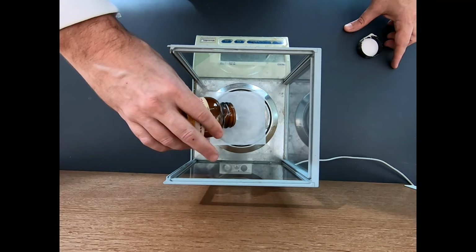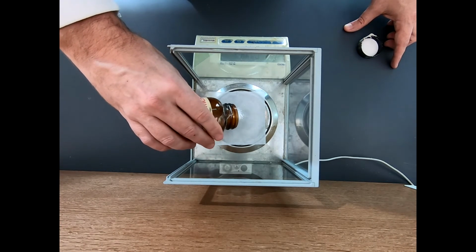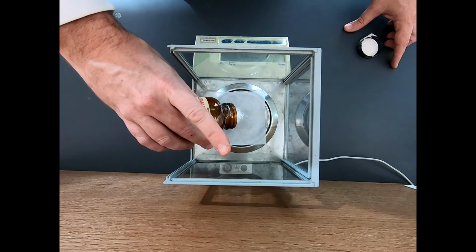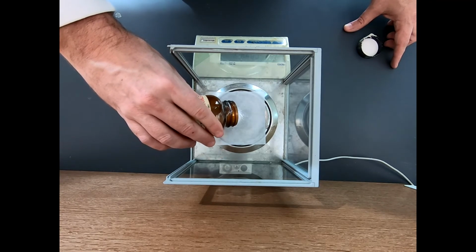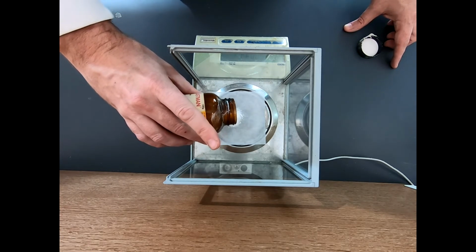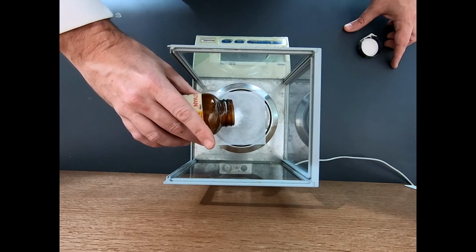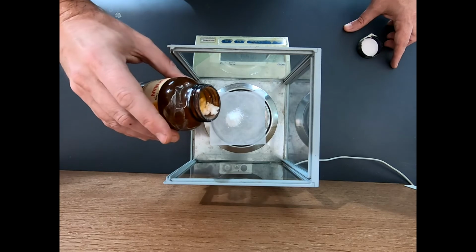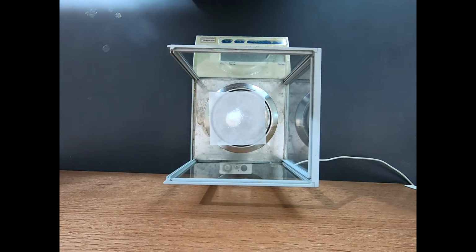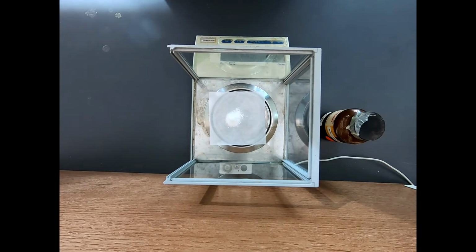Okay, it's starting to come out now. Good. There's a tenth of a gram. 0.3. And as I say in almost every one of these videos, I don't need an exact precise amount to be weighed out, but I do want to know exactly what I get. So that's 1.03, 1.045, oh there we go, 1.062. Okay, I'm going to call that 1.06. So that is very close to exactly 5 millimoles of benzoin. And now we're ready to go to the hood.